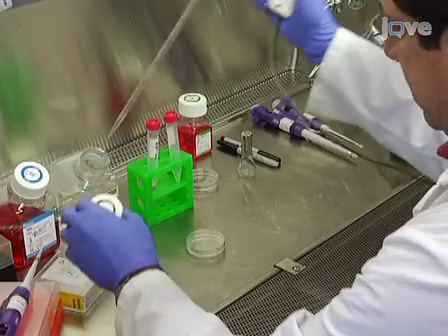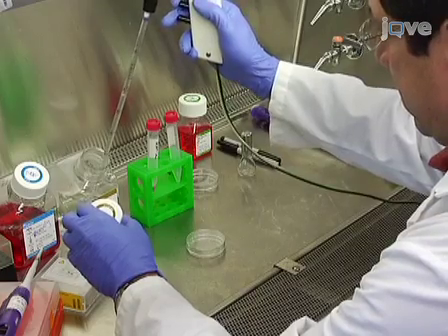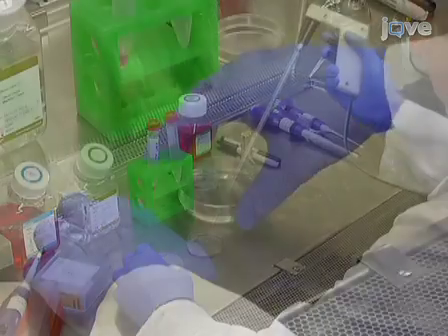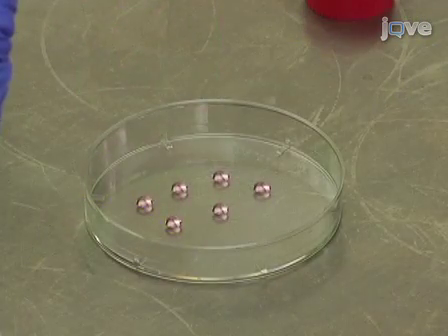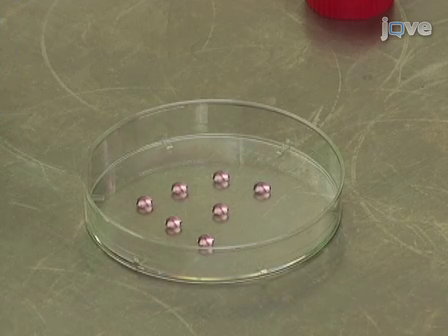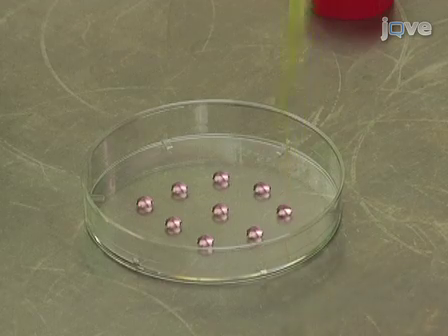Prepare a hydration chamber by removing the lid from a 60mm tissue culture dish and pipetting 5ml of PBS into the bottom of the dish. Invert the lid of the plate and pipette up to 20 10µl drops of cell suspension onto the underside of the lid. Ensure that the drops are placed sufficiently apart so as not to touch.